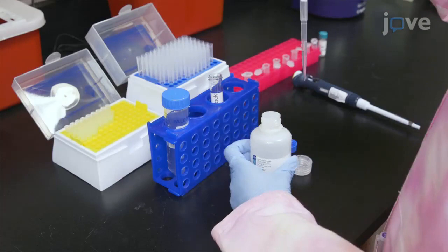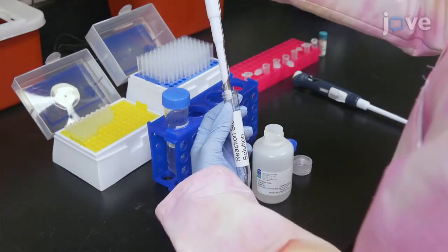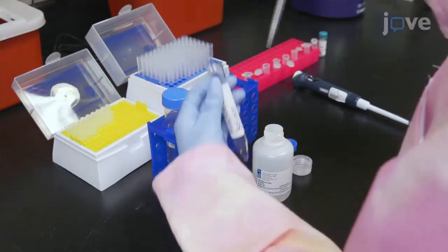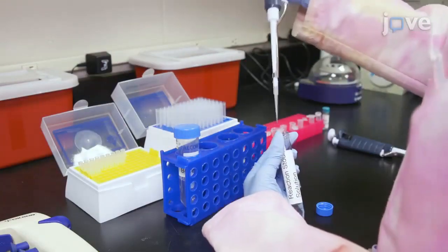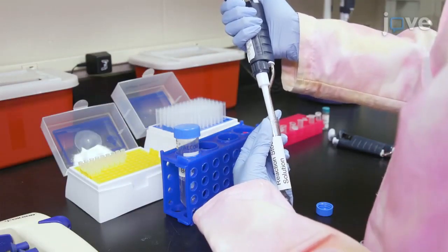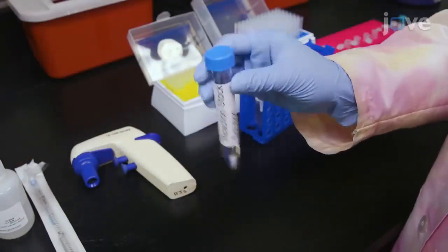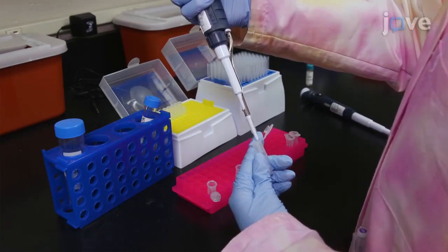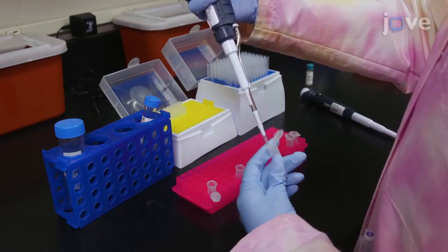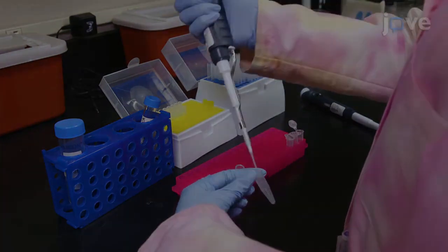Next, add 300 microliters of deuterated DMSO to a 15 milliliter tube containing 2.59 milliliters of reaction buffer, followed by 25 microliters of enzyme solution. Gently invert the tube two times to mix the reaction, and add 10 microliters of 1.5 molar hydrochloric acid to a 1.5 milliliter tube containing 582 microliters of reaction stock solution.